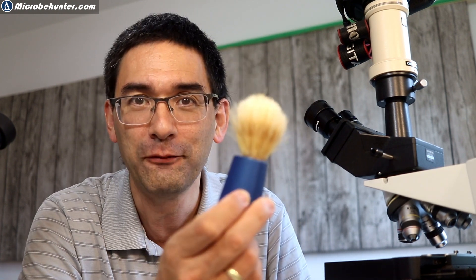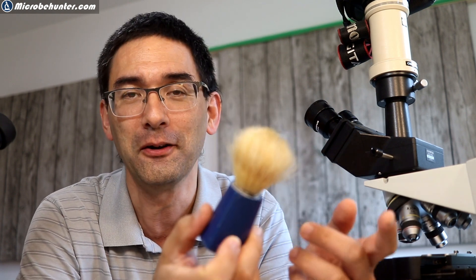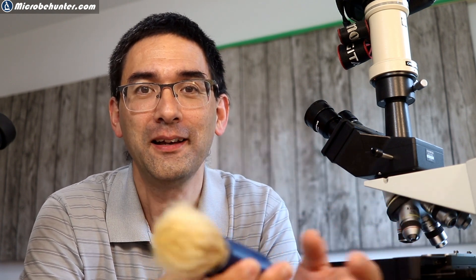There is now the possibility for you to develop amateur microscopy in a different way than I'm able to do, because I'm not living in a desert area. Don't just do what I'm doing or what many other people are doing — try to come up with new observation ideas, things that I cannot even think of. For example, if I want to put camel fur under the microscope, I have to use a shaving brush — that's my only way to get to the fur of a camel. But you're living in a region where there are different animals, so why not put fur of different animals in your region under the microscope, or insects that can be found there?